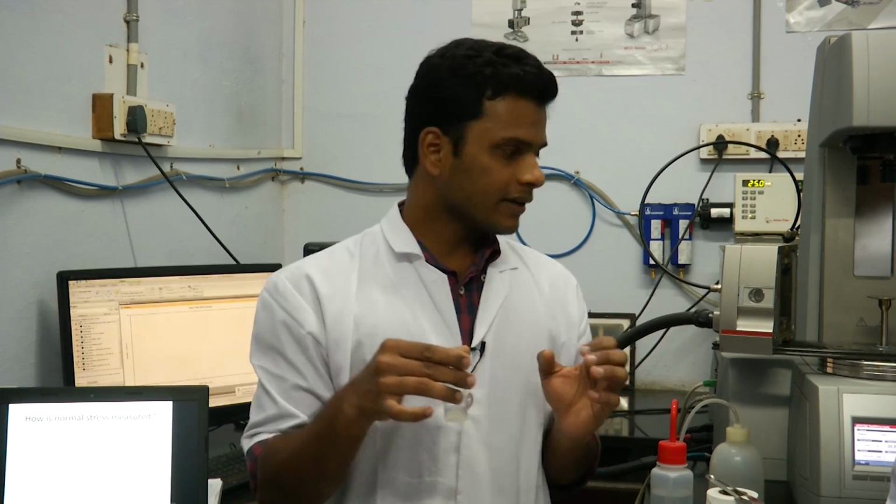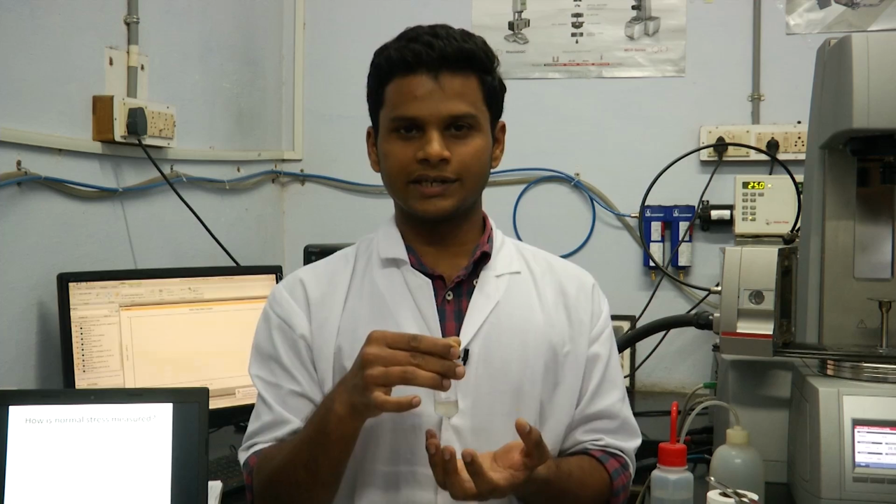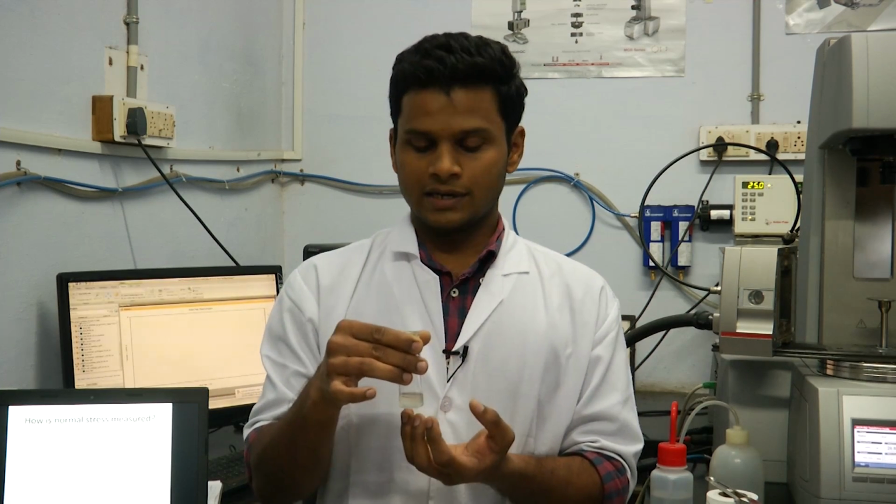So in our test today, we will look at the normal stress that is developed during the shear flow of this fluid.